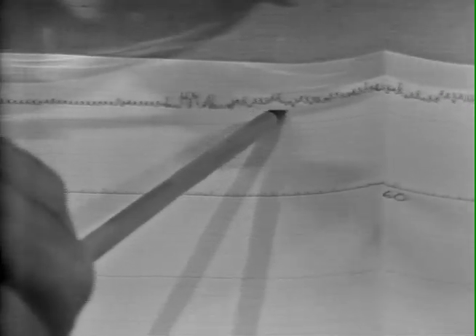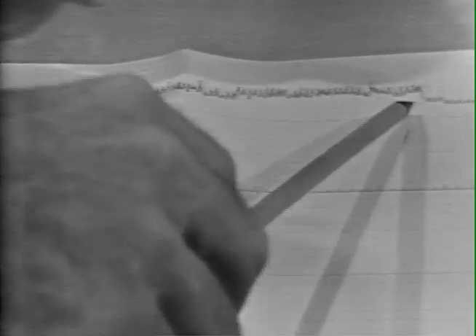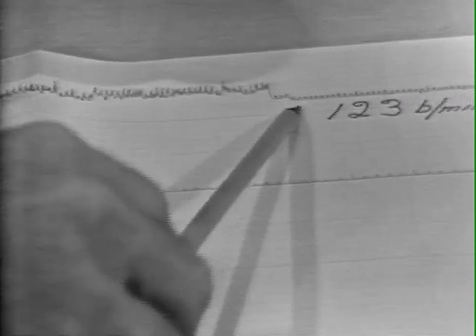We can now take a look at the full response to stimulation at 1 per second for 100 seconds. As you can see, before turning the stimulation on, we had an initial baseline contraction of 111 beats per minute. Stimulation on at this point, then as we progress, the atria not increasing very much in rate, and after about 30 seconds, marked arrhythmias set in, although these convert back to a normal rhythm at about 50 seconds.